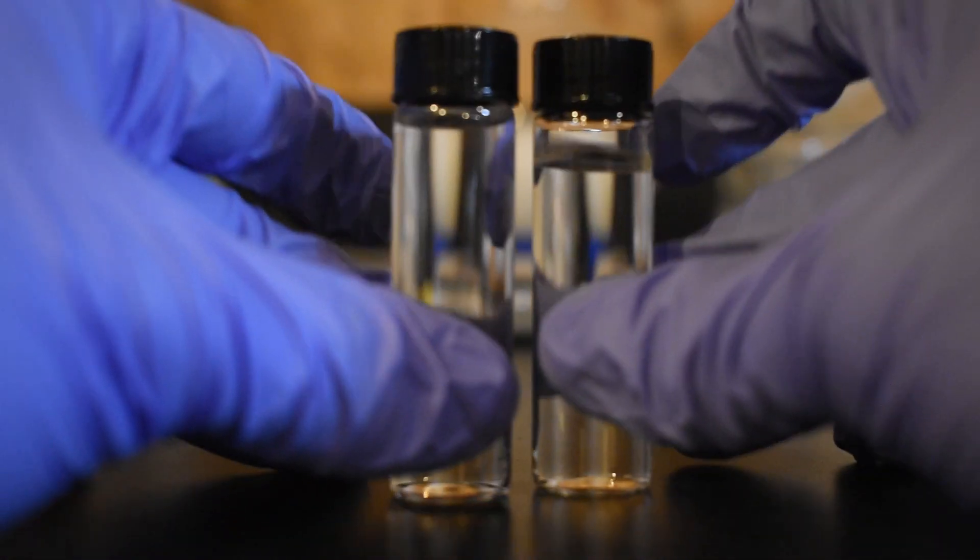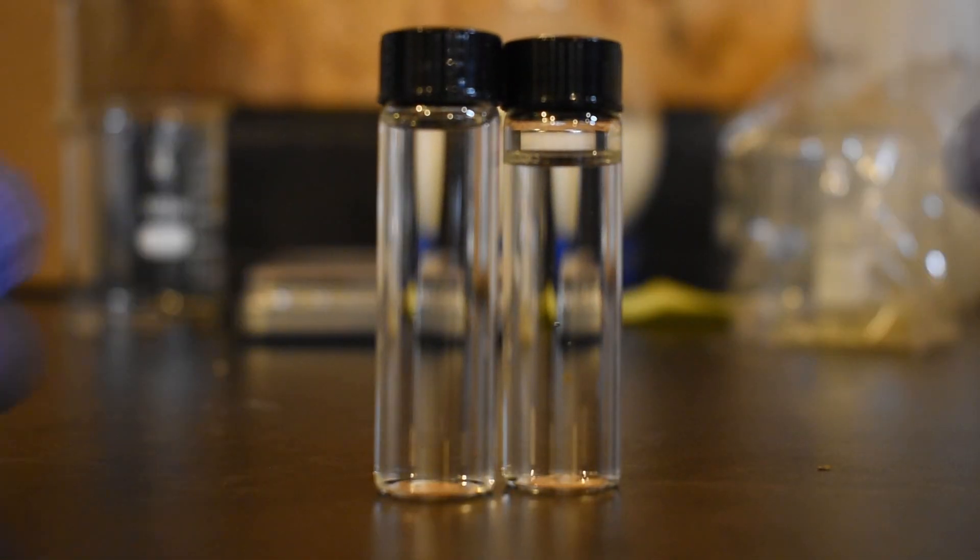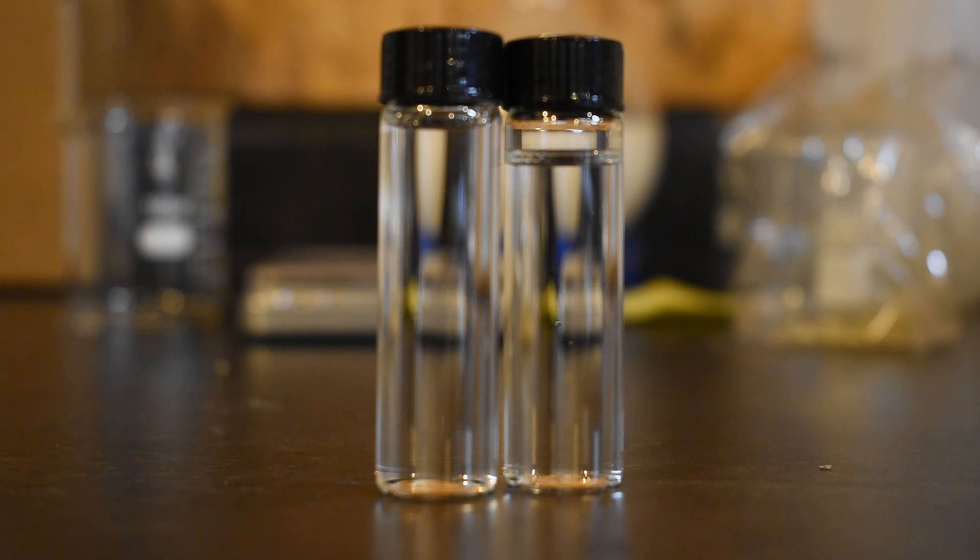Like I said, if I were to do this reaction again, I would probably let it reflux for a little bit longer, and that might help increase our yield a little bit. Some of the reactants might have also not been 100% dry at this point, and that could have also hurt our yield a little bit.